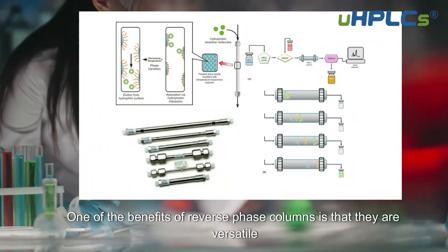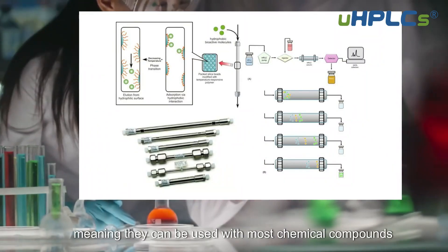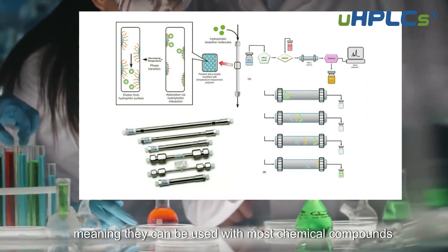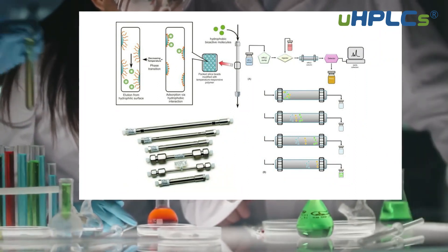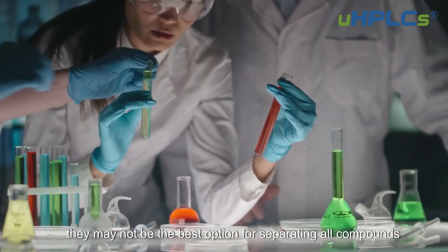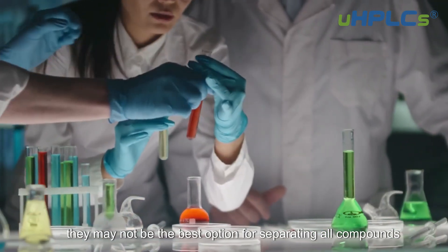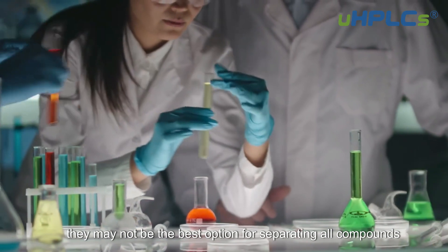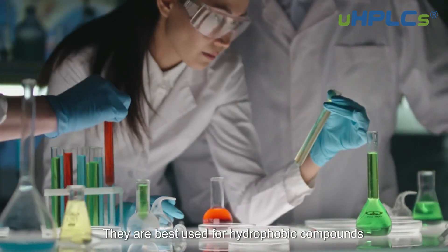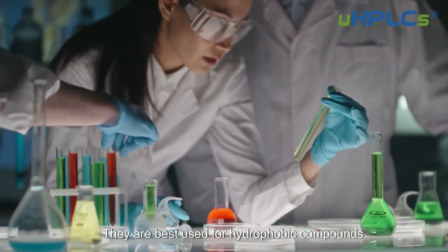One of the benefits of reverse phase columns is that they are versatile, meaning they can be used with most chemical compounds. However, they may not be the best option for separating all compounds. They are best used for hydrophobic compounds.